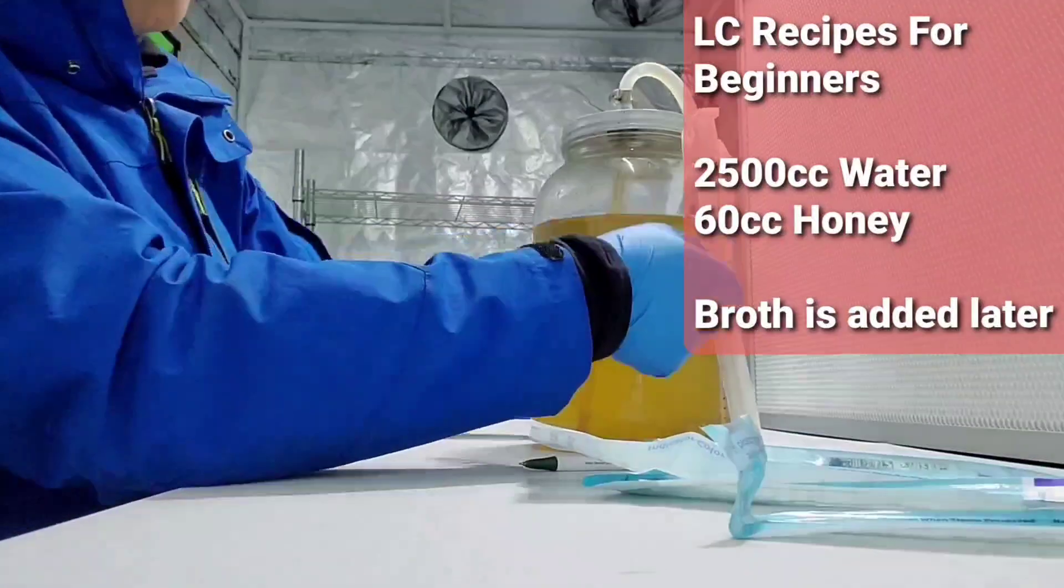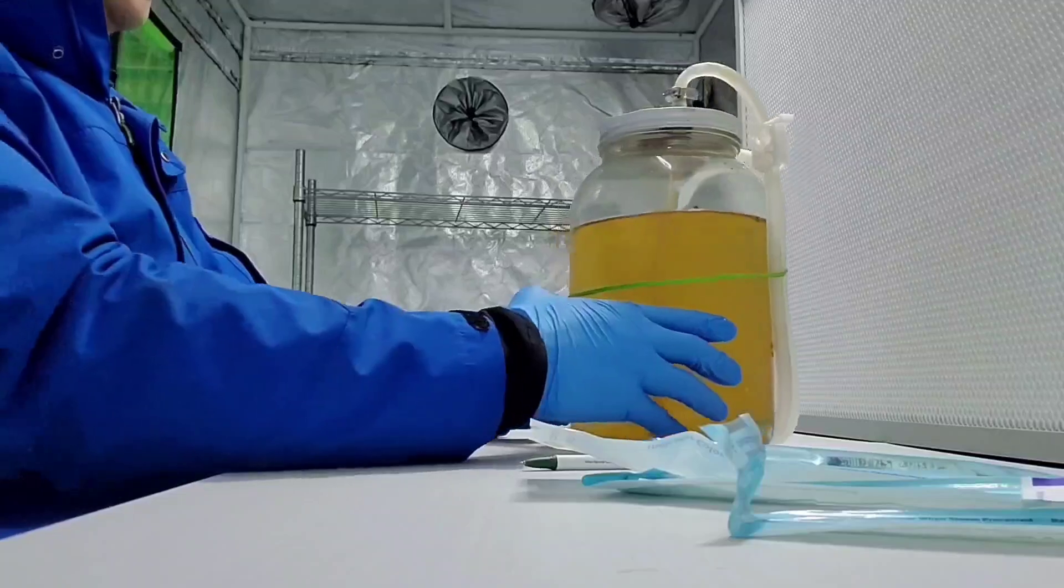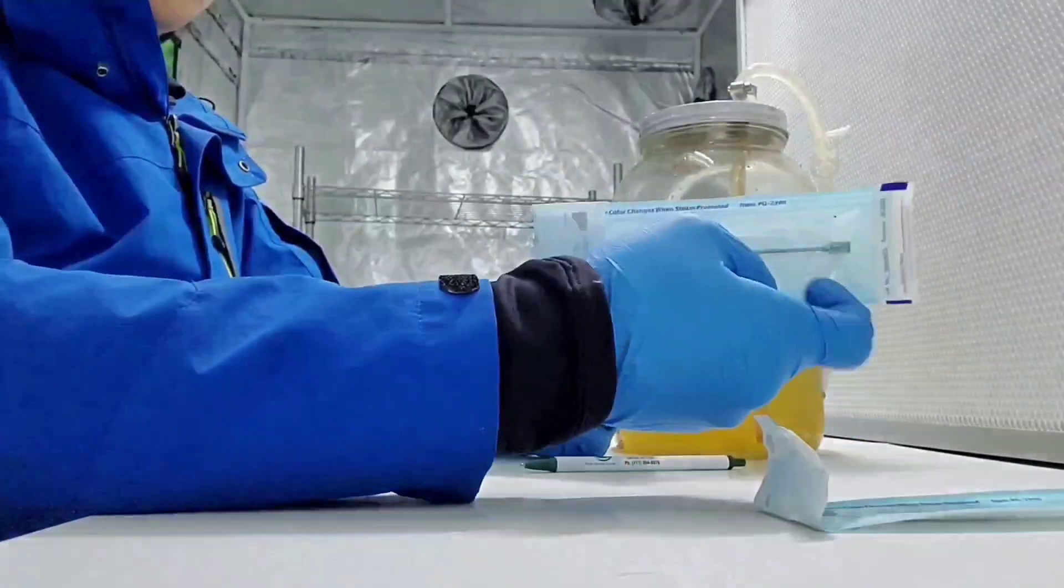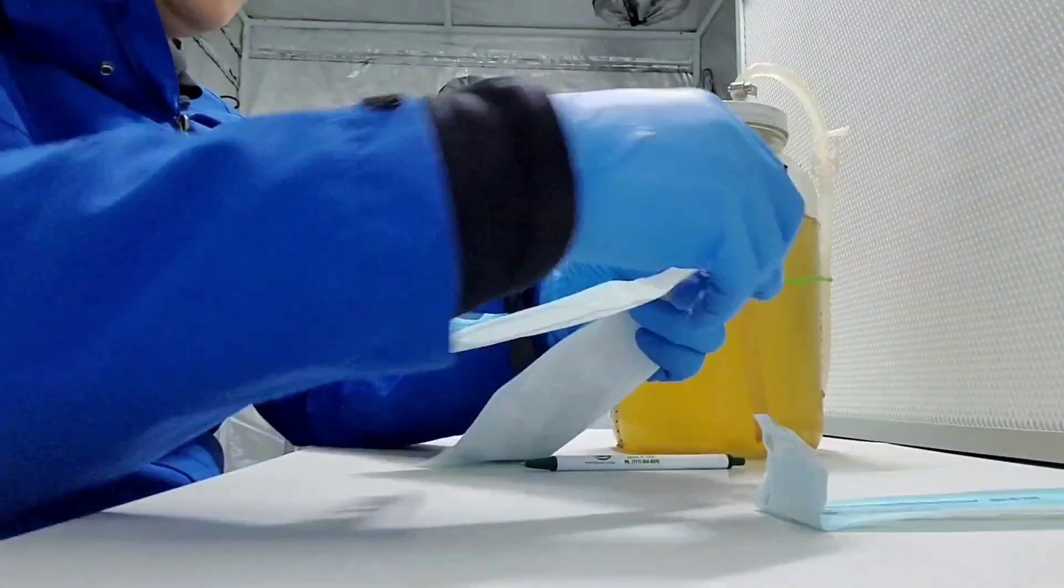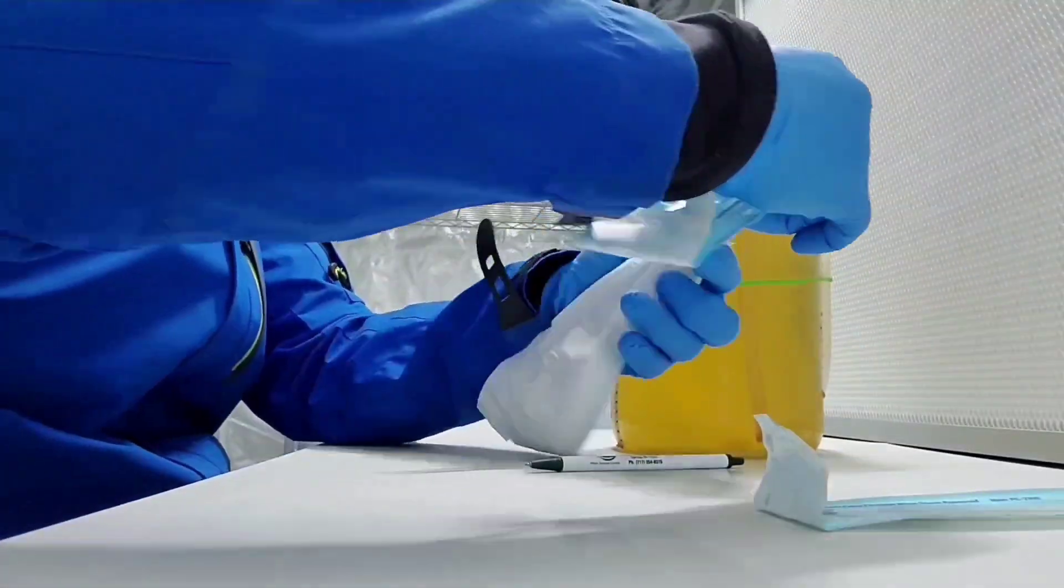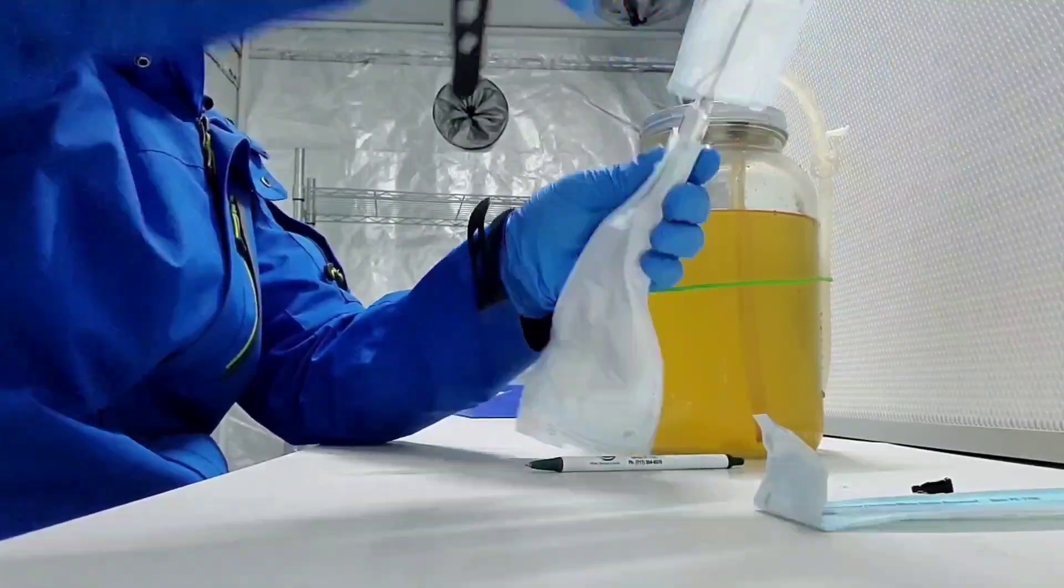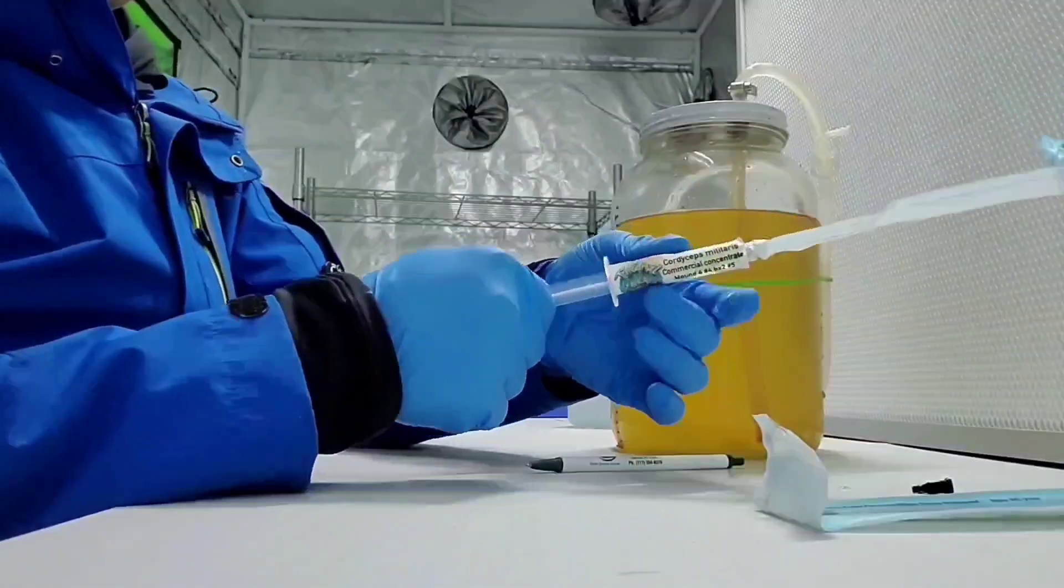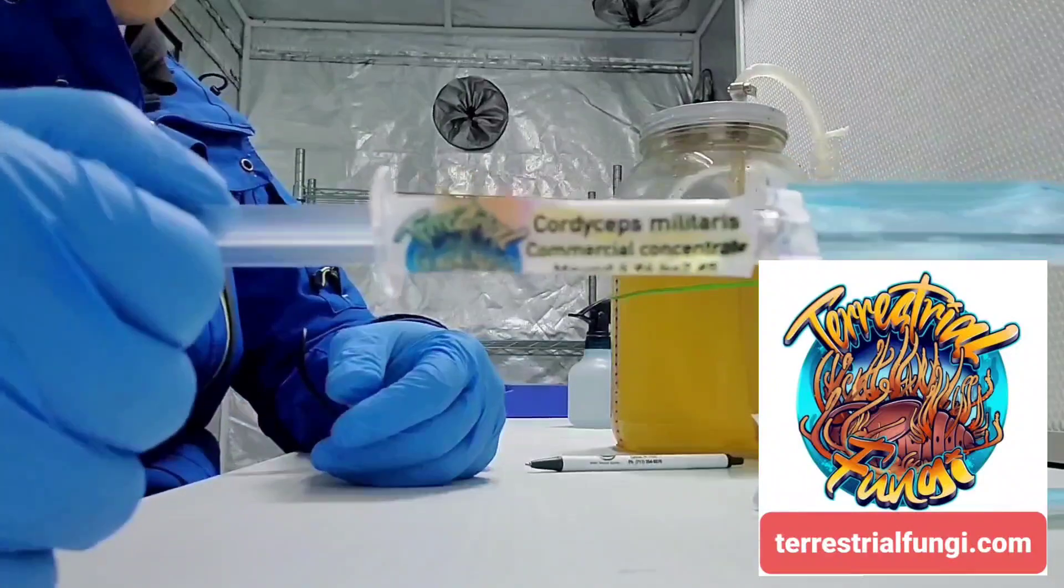This is the jar I use, but you might have different jars. This is a 14 gauge needle. Of course, this is purchased from Terrestrial Fungi.